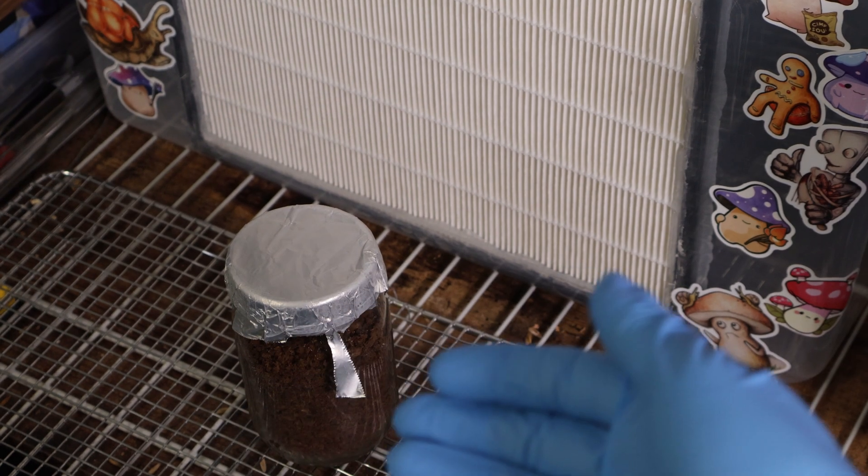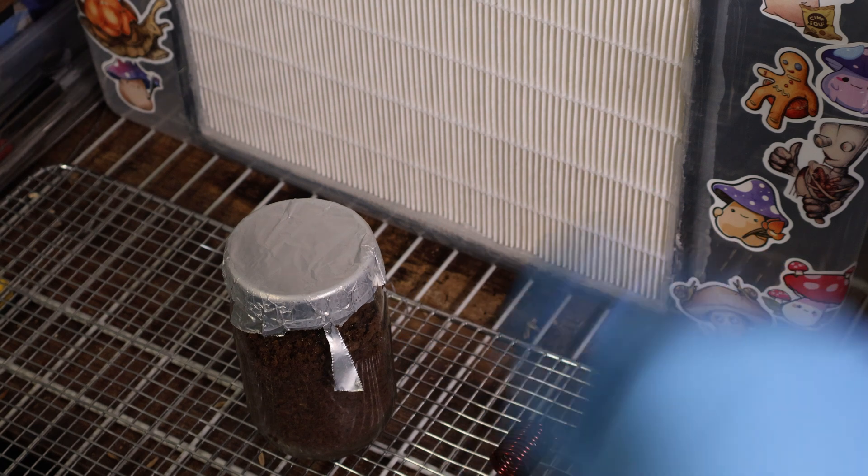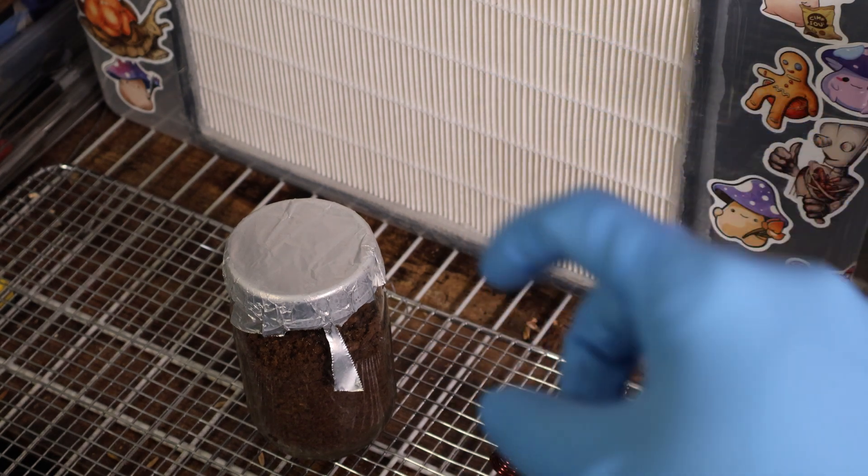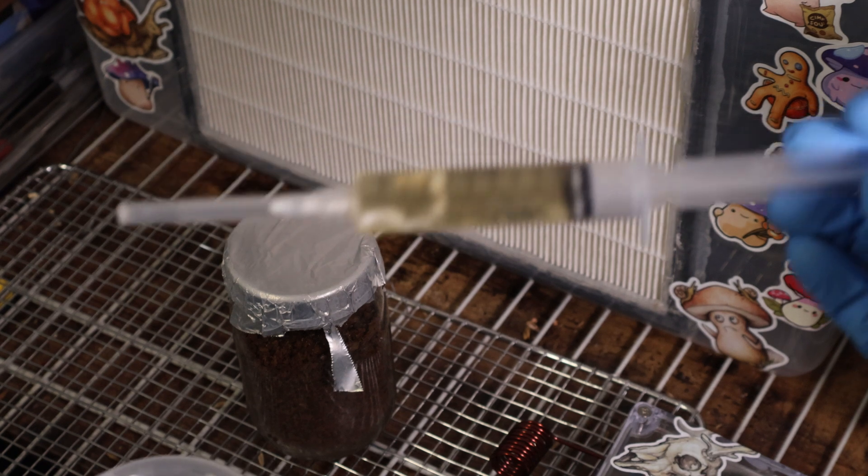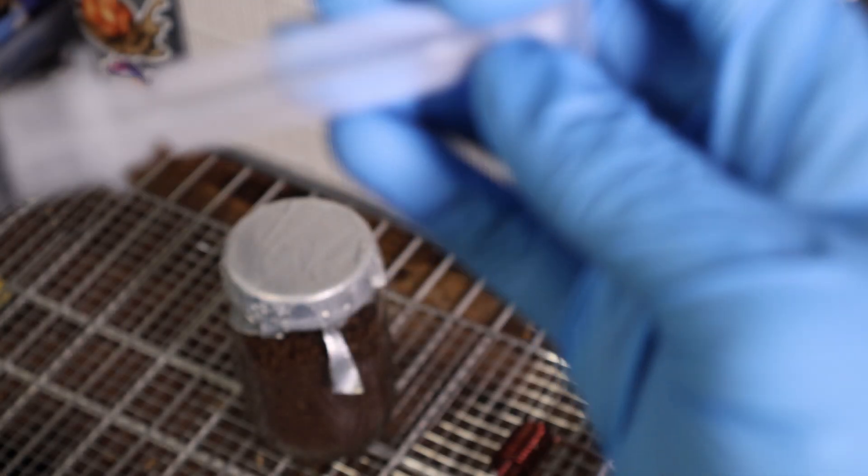This is just the leftover hardwood and oats that I used to top the dowel pins for outdoor logs. I figured I'm going to make this maybe some indoor spawn and just see if something takes hold rather than waste all that. Nice to do something like really aggressive. Maybe I'll just do a nice pearl oyster. Look at this pearl oyster that fruited within. Maybe I'll try and use that up so this syringe doesn't go to waste. Let's go ahead and do that.